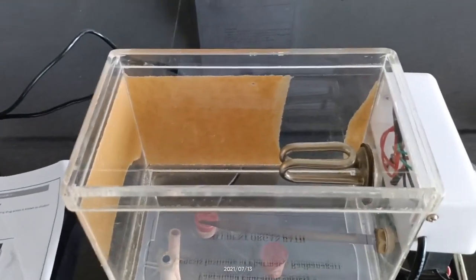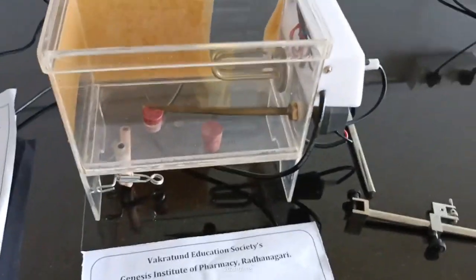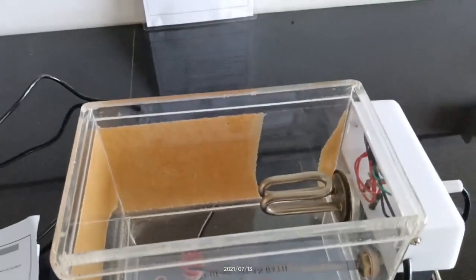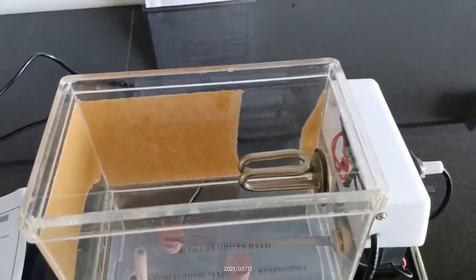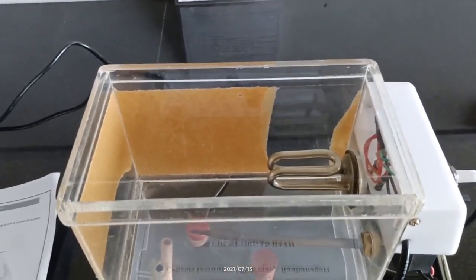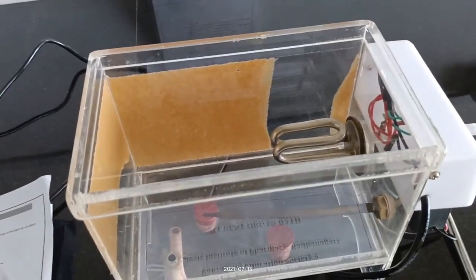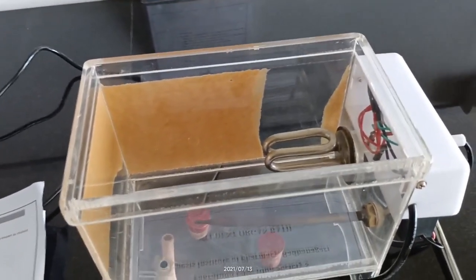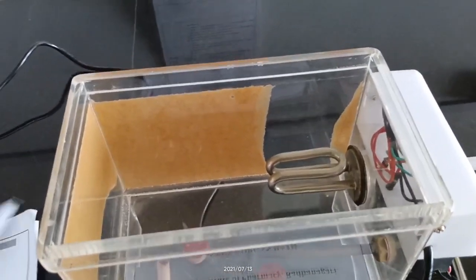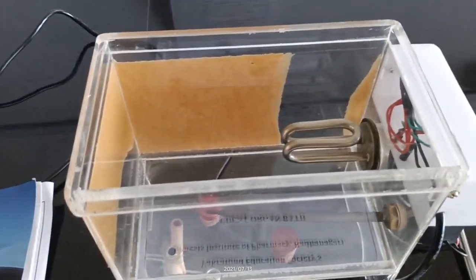The next part is the aerator or aeration tube. The aerator produces or generates oxygen. The aerator tube is a part that provides oxygen to the organ tissue placed inside.